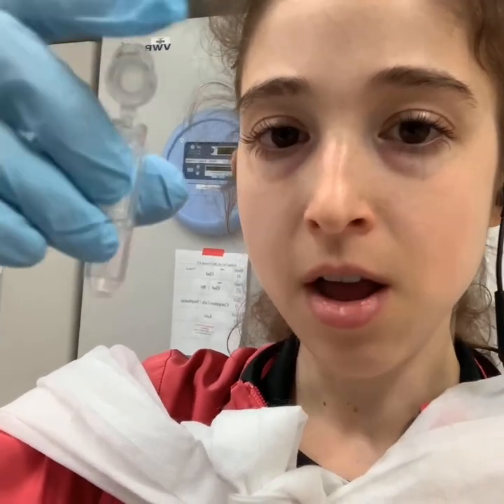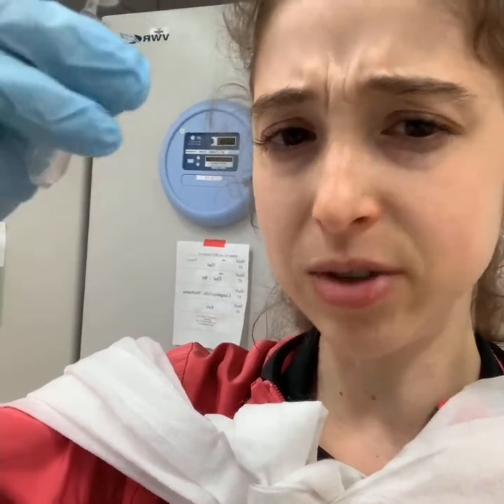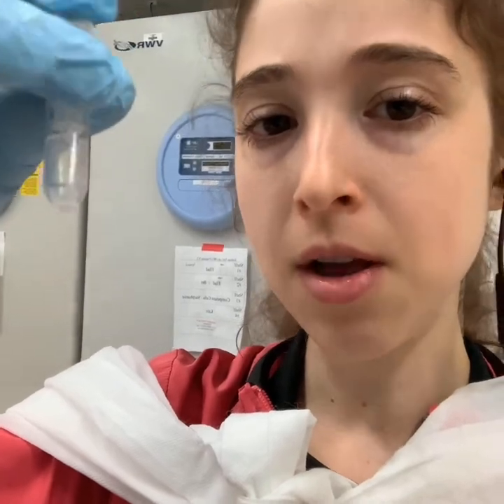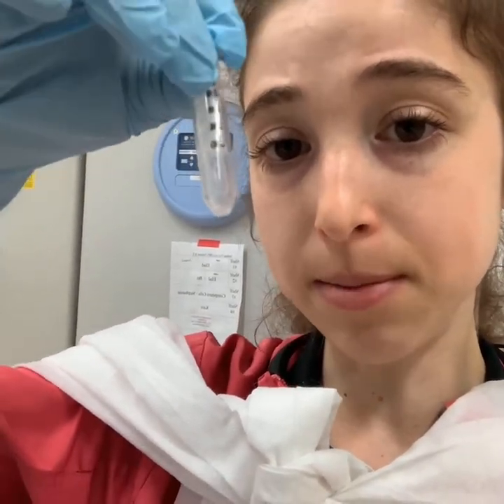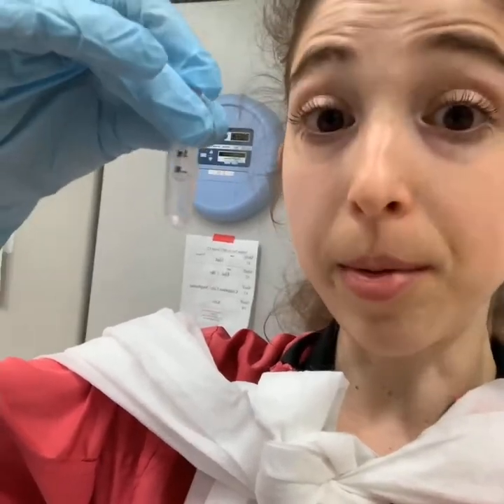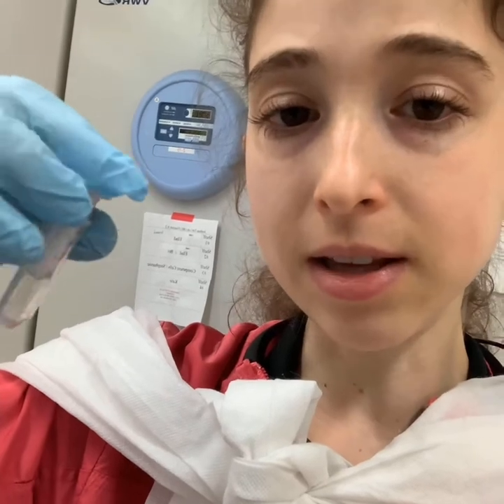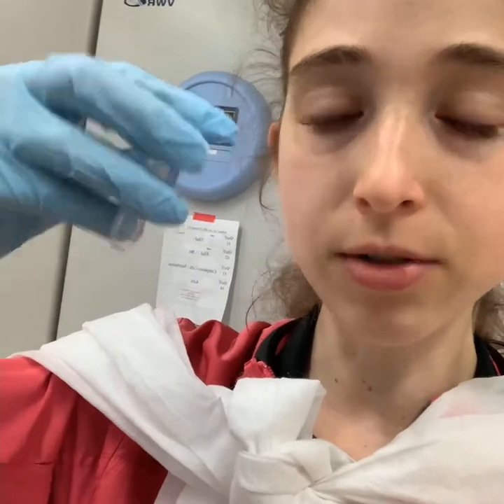When these come, they have a small amount of glycerol — a sugary thing — on the membrane. What I do is pre-wet the membrane: before I put my sample in, I put some plain buffer in, spin it for just a couple minutes, let the membrane get used to the buffer, then pour that out and put my sample in. Make sure you never let the membrane re-dry after that — do it just before your sample or leave the buffer in there.